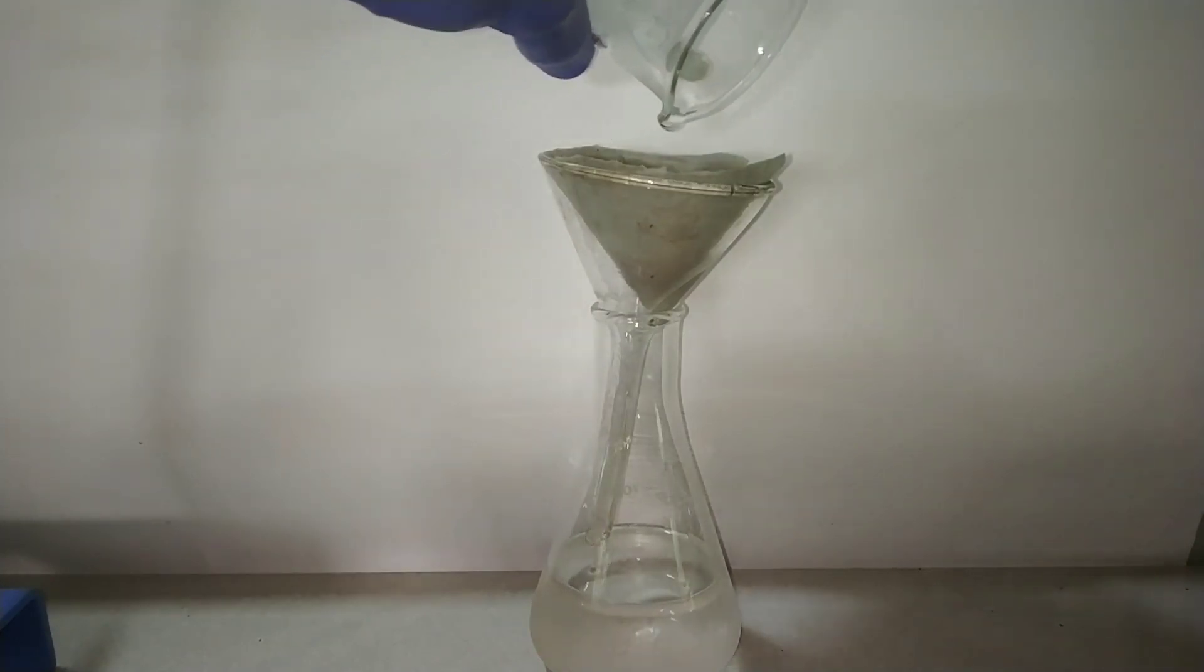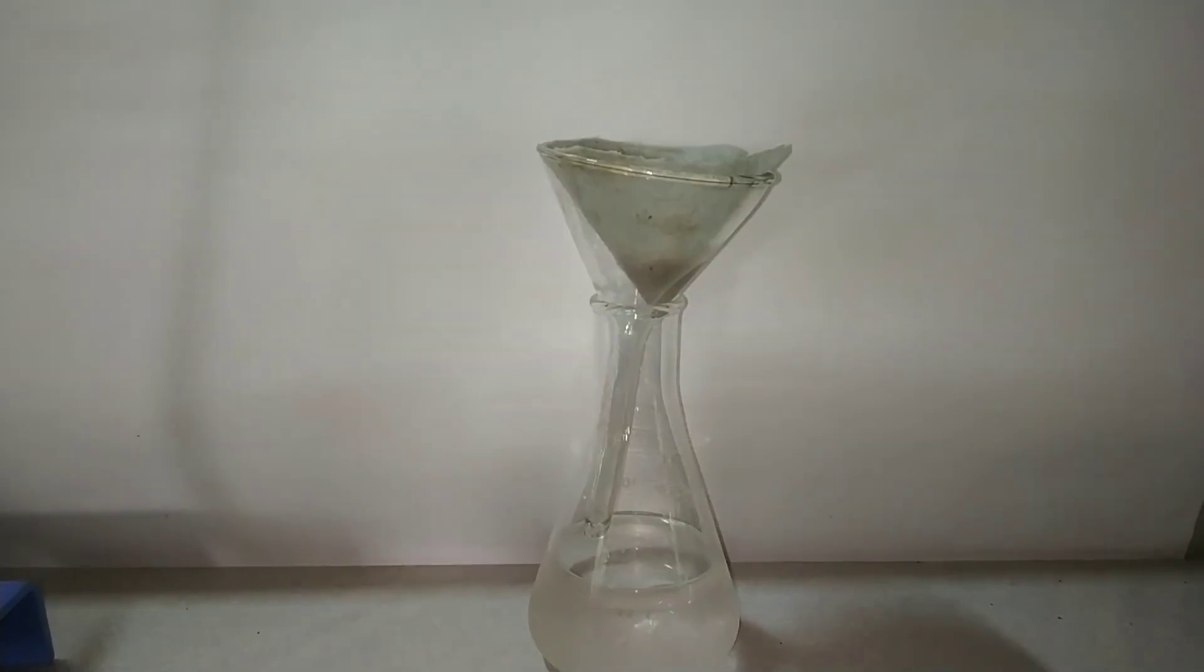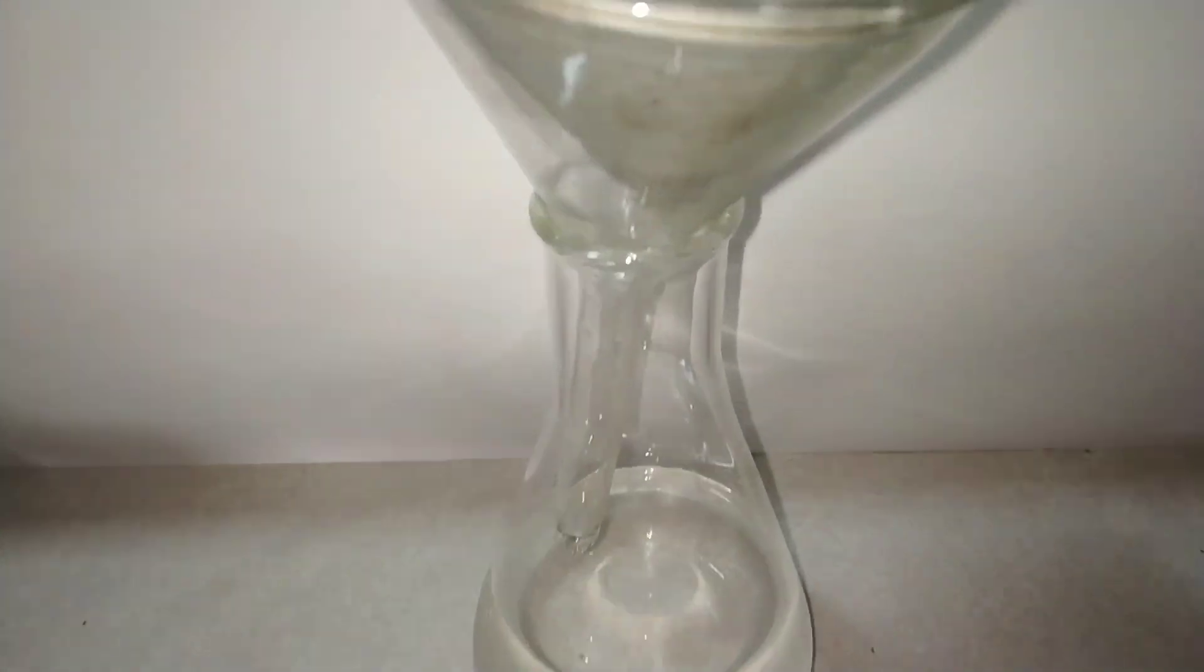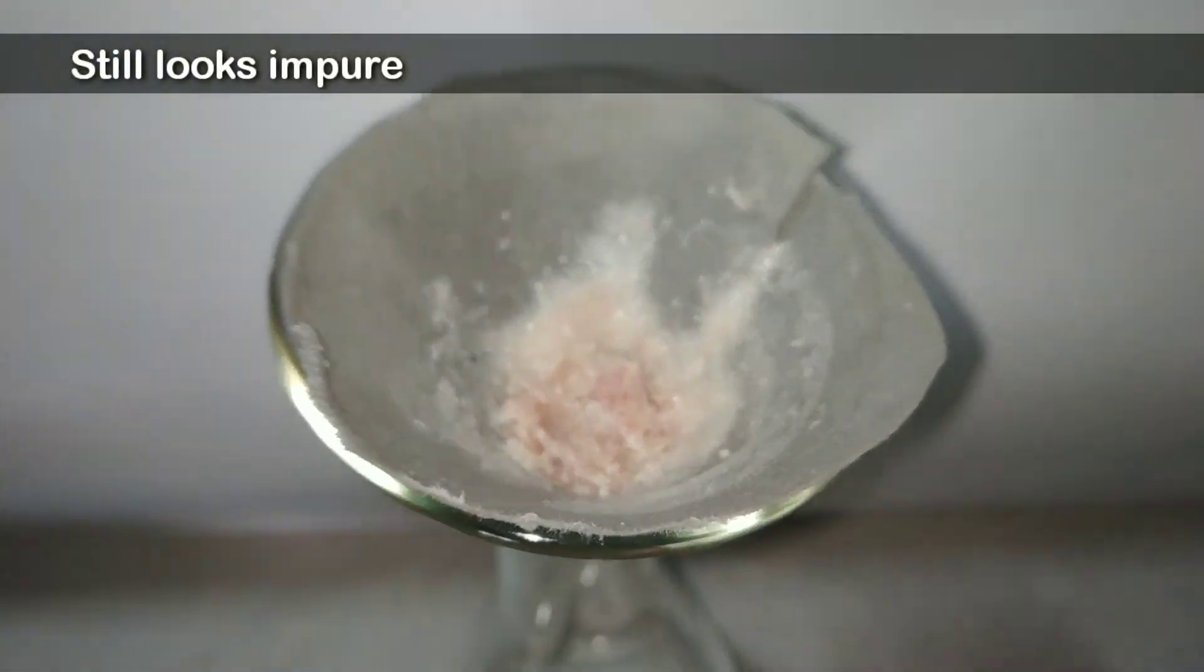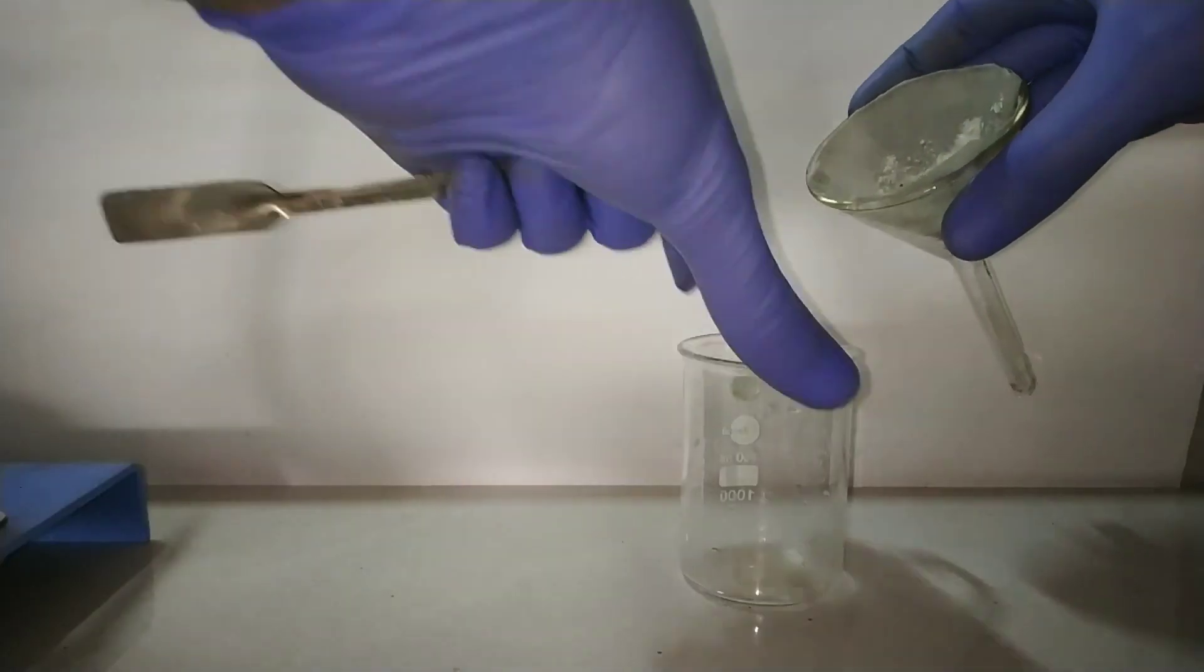Anyway, I just washed 4 to 5 times and you still see the product as impure. You can see that red color even now. I am going to purify the product now by recrystallization.